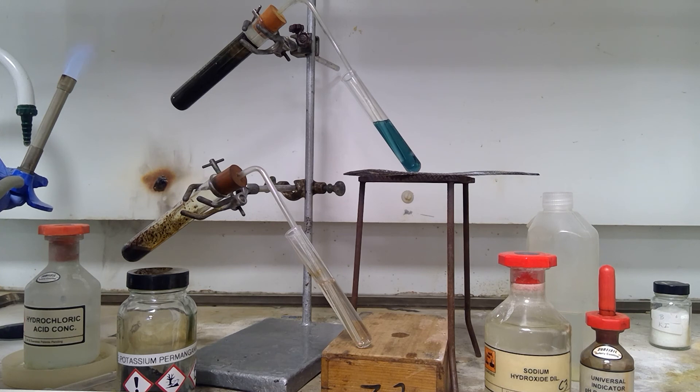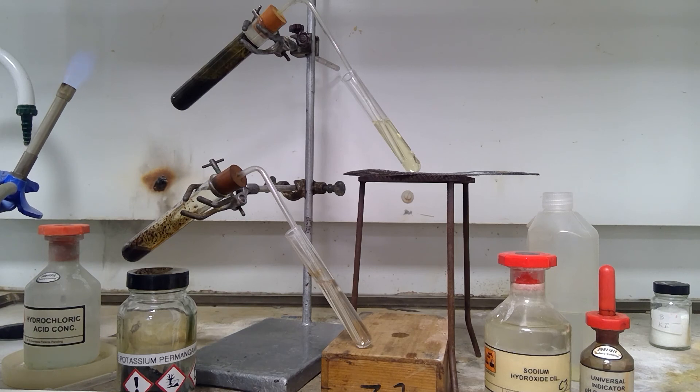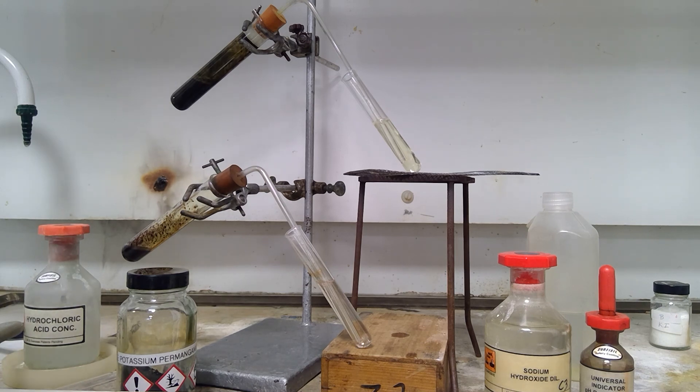At last we are just starting to see now that the color is heading towards a more green color. You can see that we start to see a little bit of yellow. And as we did with the other experiment we don't seem to see the formation of any red color as a result of the two acids because the chlorine acts as a bleaching agent and so the color of the universal indicator is not seen.